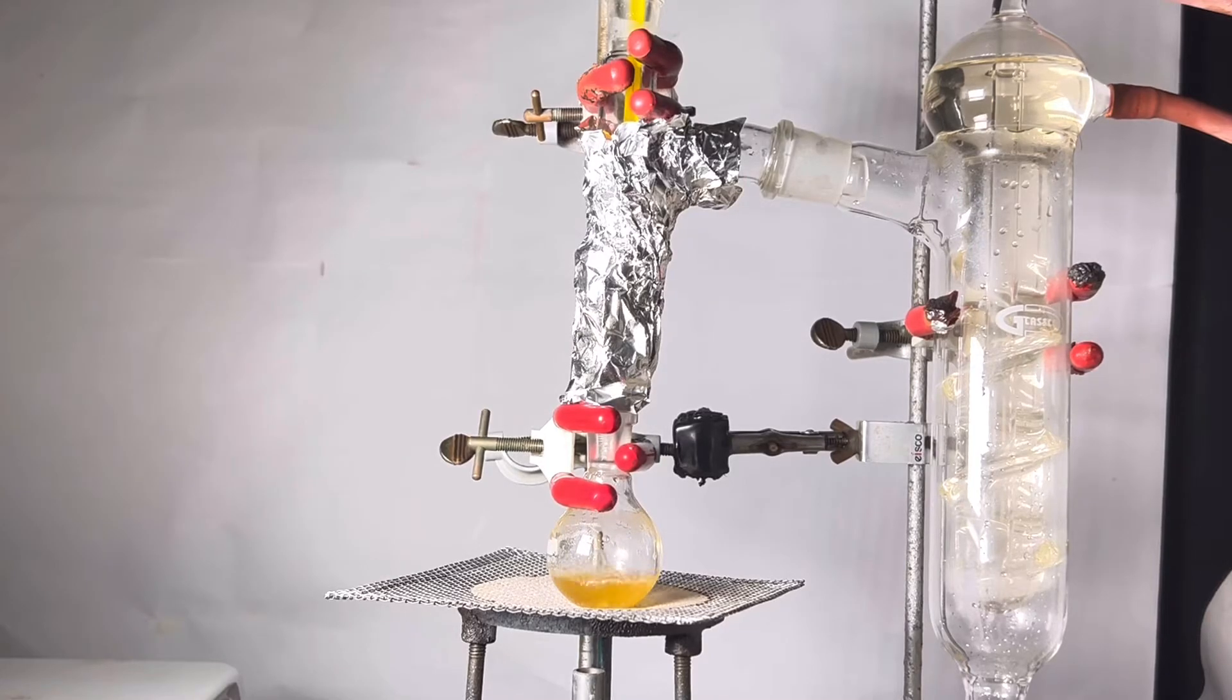If you have a short path distillation apparatus, that is the best thing you will need. But since I do not have it, I will keep going with this.